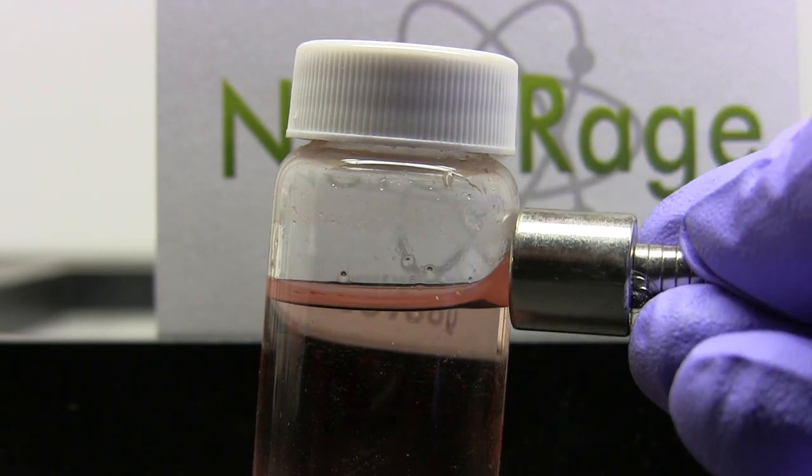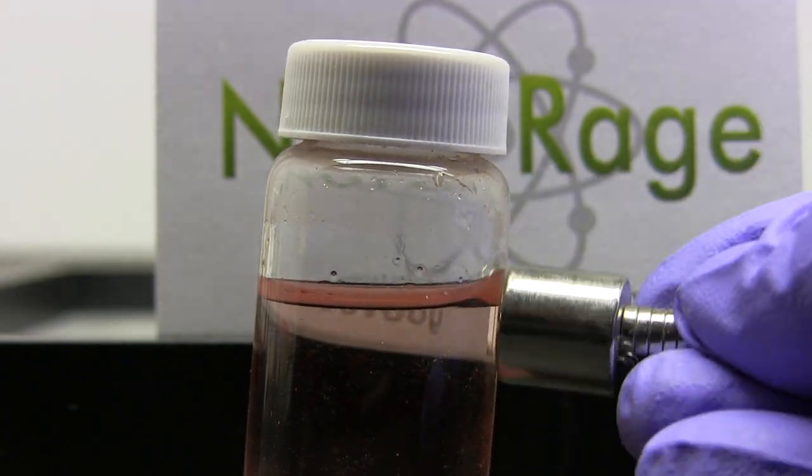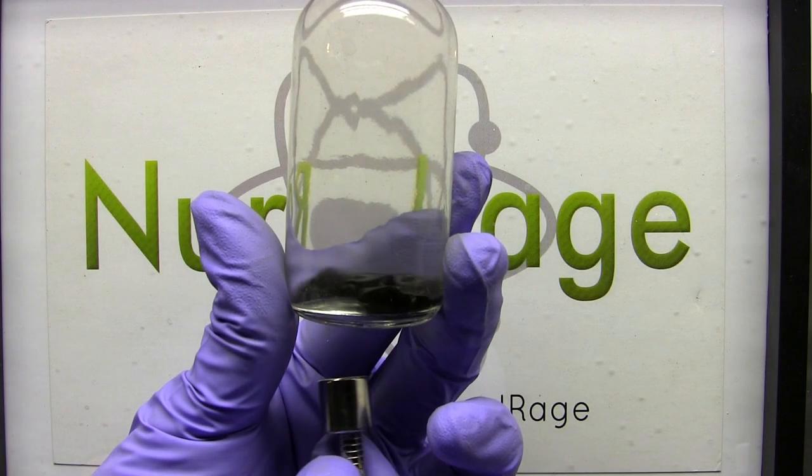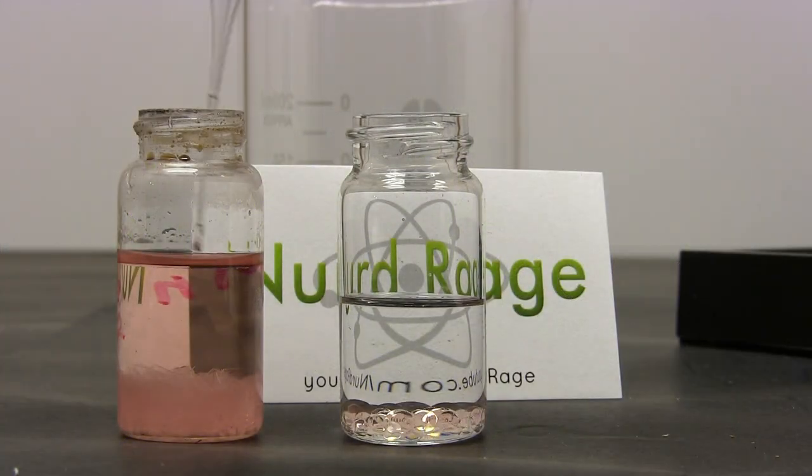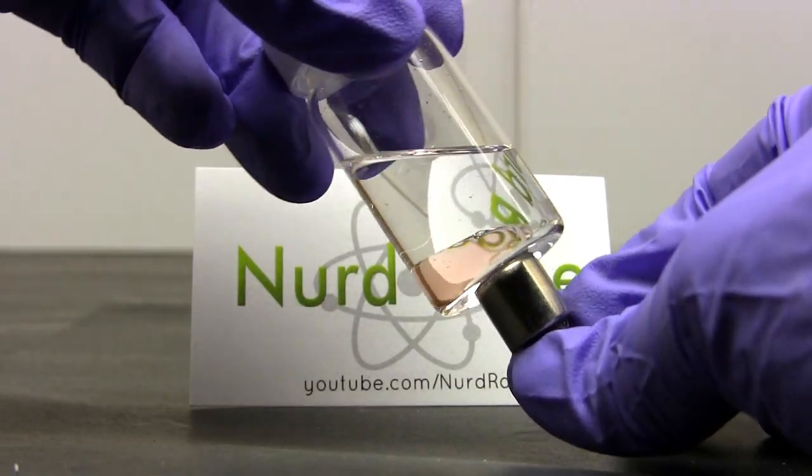The effect is not nearly as strong as in ferrofluid, so to help it along we're going to try and suspend it in another non-miscible fluid. Ferrofluid uses mineral oil, but we can't use that because saturated manganese nitrate solution is too dense and still won't move very much.